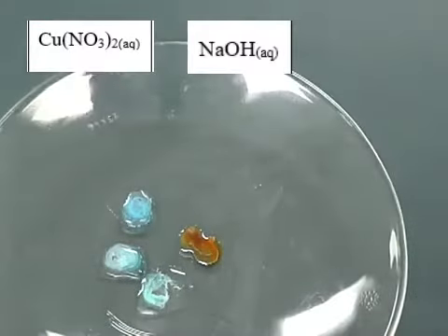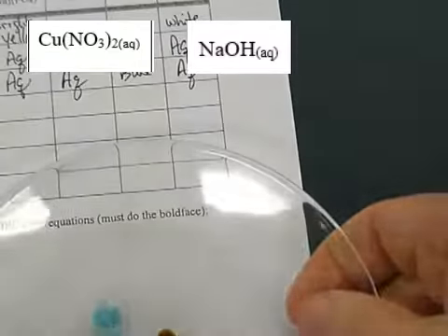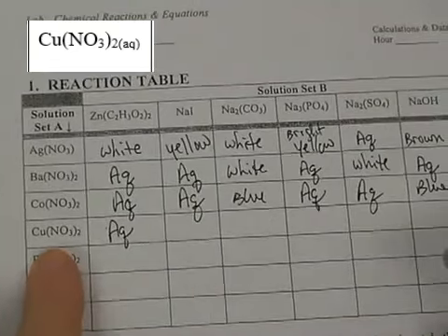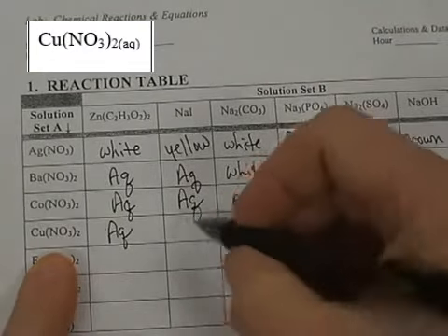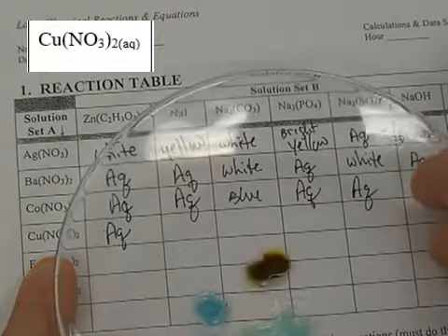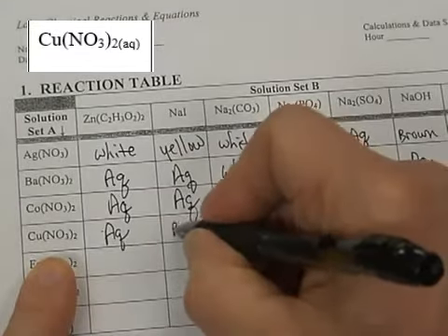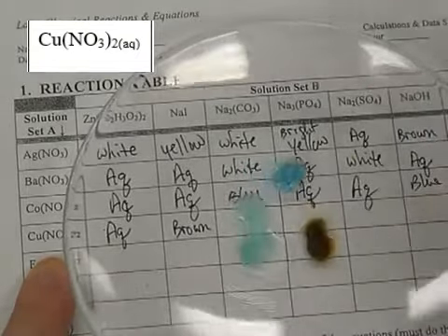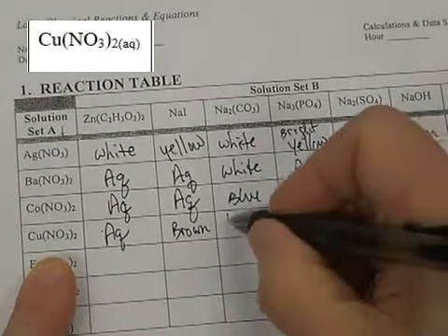And you can see a reaction occurred. So there's a nice blue precipitate for sodium hydroxide. We're on copper nitrate here. And we already said that zinc acetate was aqueous. And then we had the brown color here was the sodium iodide, so we put brown here. Sodium carbonate was the lightish blue. Actually, the next two were light blue, so light blue.